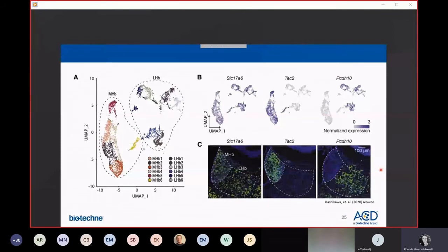It was known that the habenula can be divided into medial and lateral portions. For example, neurons in the medial habenula play a critical role in regulating nicotine reinforcement and anxiety and fear-related behaviors. Here in this UMAP plot, we're seeing just the 12 neuronal clusters that correspond with either medial or lateral habenula neuronal clusters, and they are clearly delineated based on expression of markers, including TAC2 and protocadherin 10. Here, this is RNAscope data using probes for these gene targets, and you can clearly see this anatomical delineation of medial versus lateral habenula, and then this is a marker that's common to both sides.